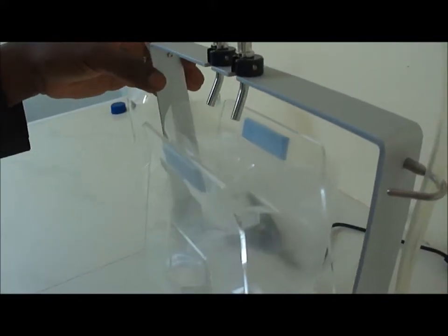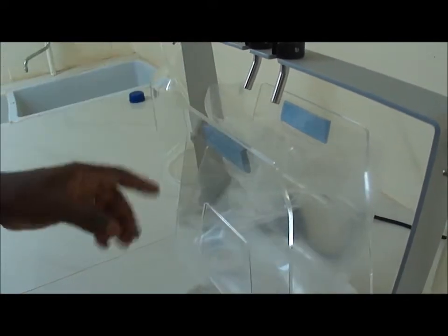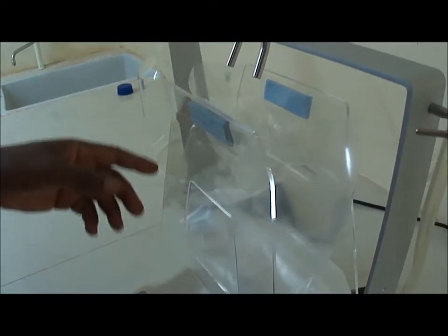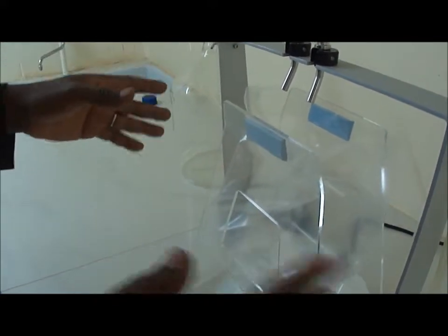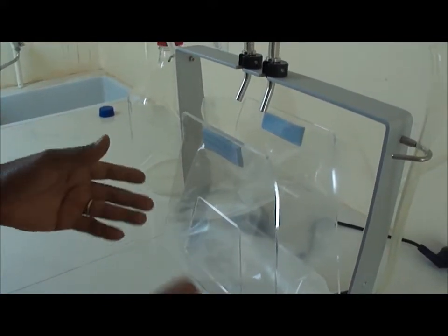But if you push it on the front, that will start actually, that will trigger the pumps. But we are going to use only one pump. But as you have seen, you can use the two pumps to make your dilution.